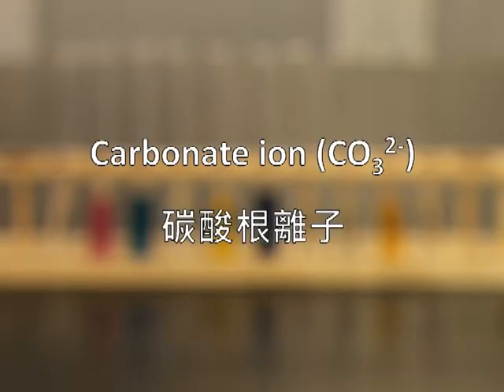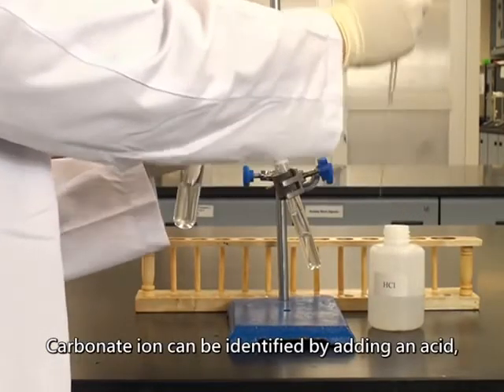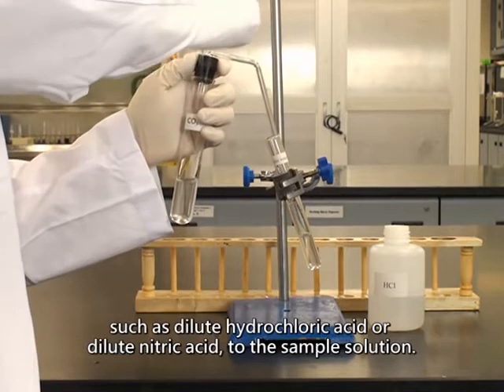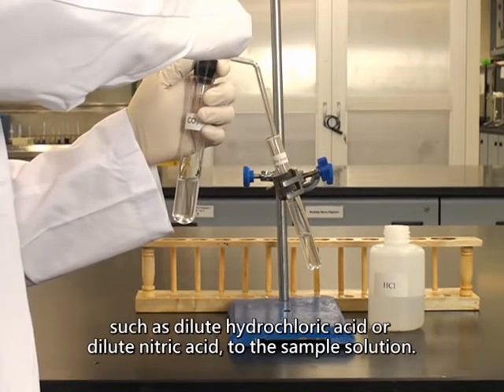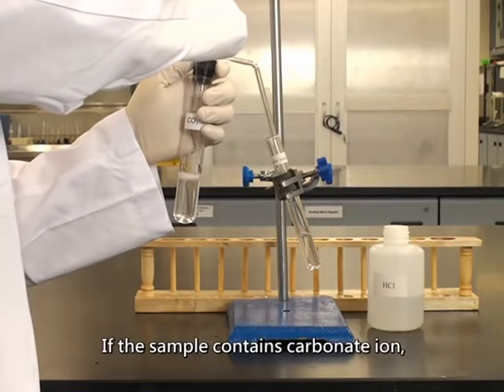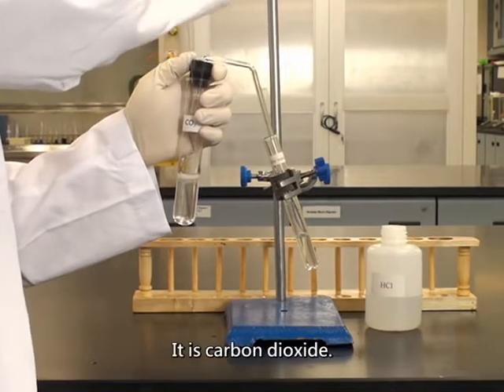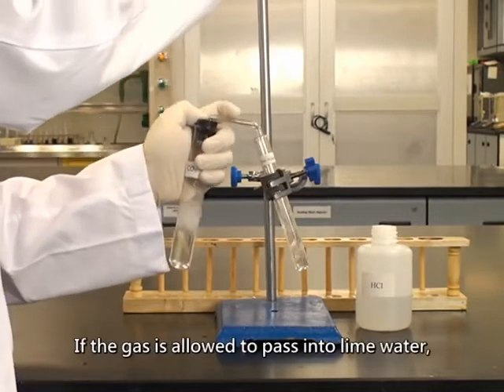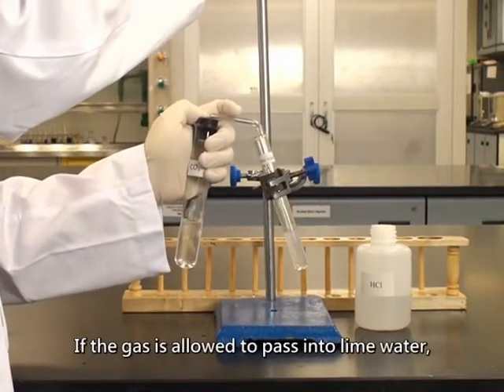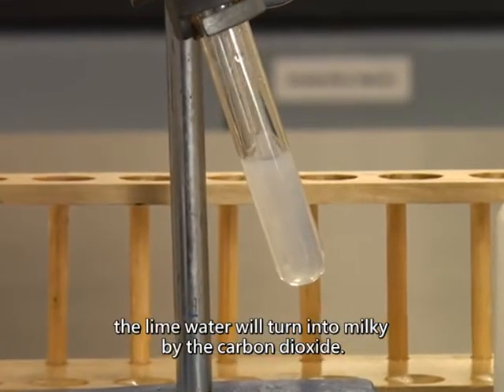Carbonate ion. Carbonate ion can be identified by adding an acid, such as dilute hydrochloric acid or dilute nitric acid, to the sample solution. If the sample contains carbonate ion, a colorless gas will be produced. It is carbon dioxide. If the gas is allowed to pass into lime water, the lime water will turn milky by the carbon dioxide.